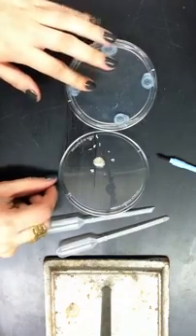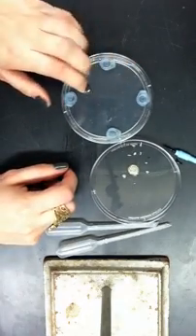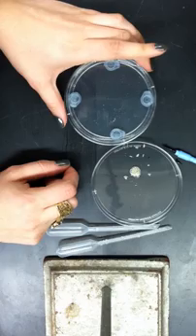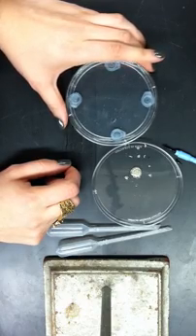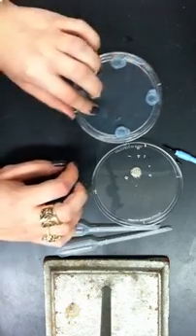First, we're going to start off with training, where you have to have one fructose plate pre-made. So I made this a few days ago, and now it is going to be the sugar or fructose plate for training.